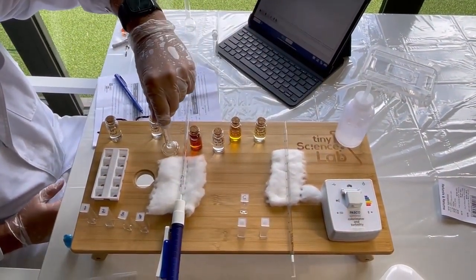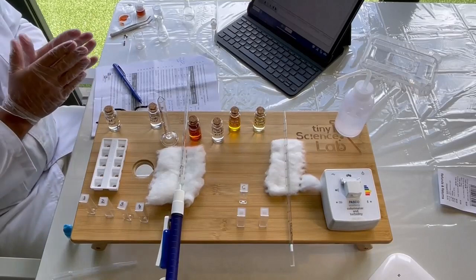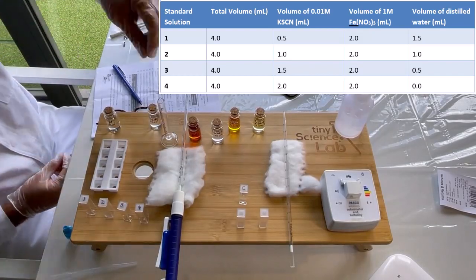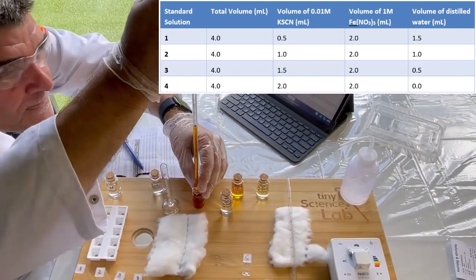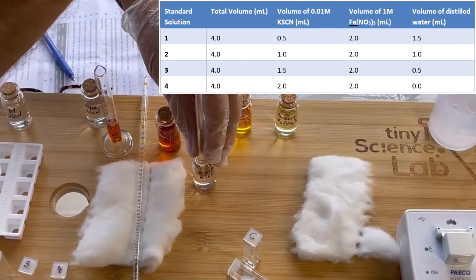And the first thing I'm going to do now, you'll notice that I have 4 cuvettes here, 1, 2, 3, 4. And what I've done is I've written down a different sequence combination for each of these solutions. So I'm going to start my first solution, and I'm going to use 0.5 mils of my potassium thiocyanate, and I'm going to combine that with 2 mils of my iron nitrate.